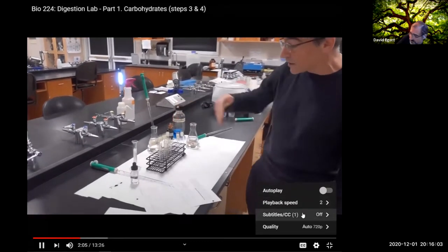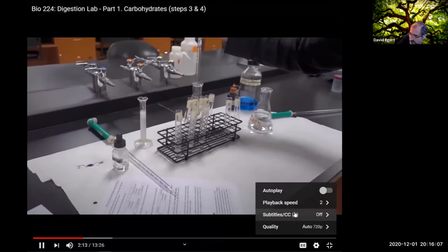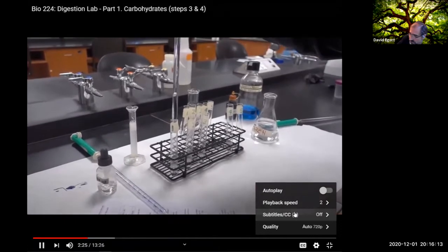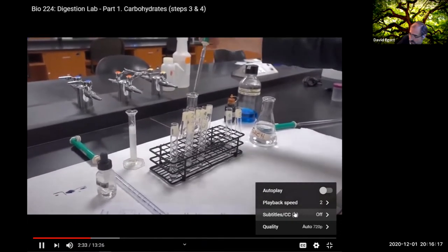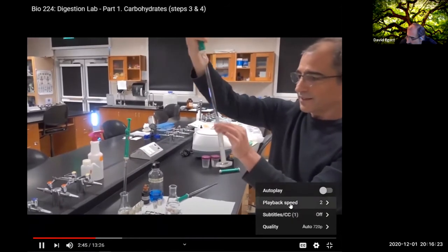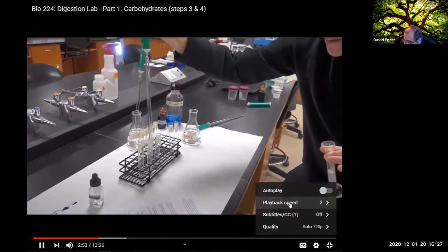All right, so we have starch in our 3 unknown tubes here. Test tube 1 is going to just fill out our volume by adding 3 mils of water. We got 3 mils of water in test tube 1. Test tube 2, we have to add 3 mils of this quality high grade saliva. Let's bring this up to 7, so we spit it out into there.